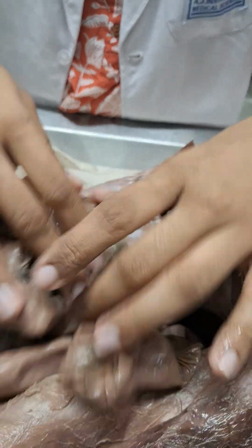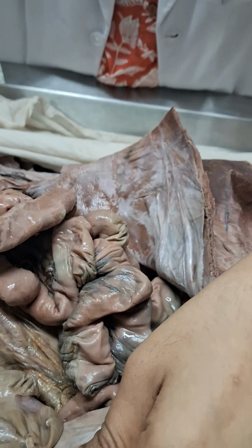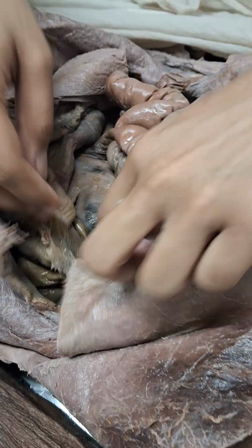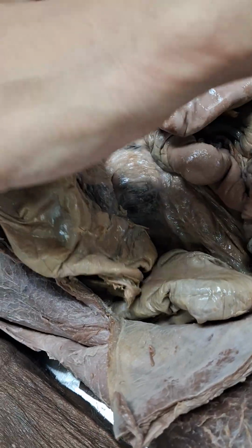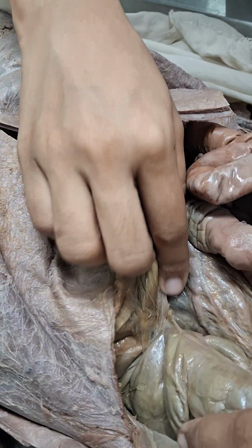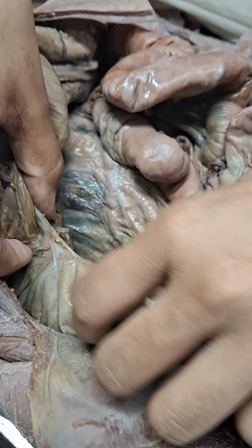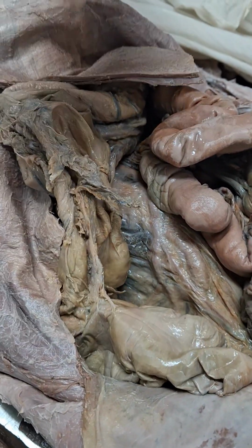That is about the small intestine exterior. Interior we'll be doing on that table. Large intestinal features that might differentiate the large intestine from the small intestine. First of all, you have haustrations which are sort of visible. This looks a little distended, which is not normal, but it's okay. You can somewhat make out here that there is a constriction in this area, a dilation in this portion. Dilation here, constriction here, dilation here, constriction here. Those are haustrations, point number A.